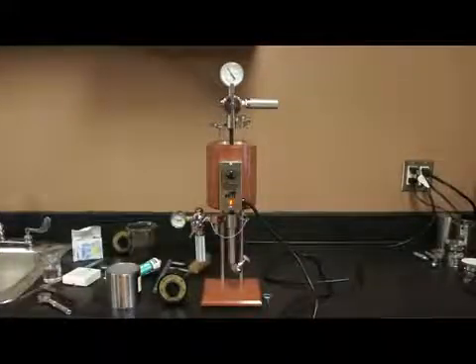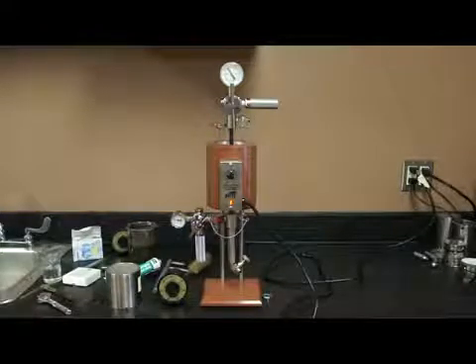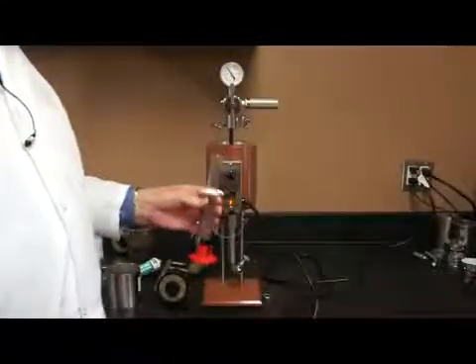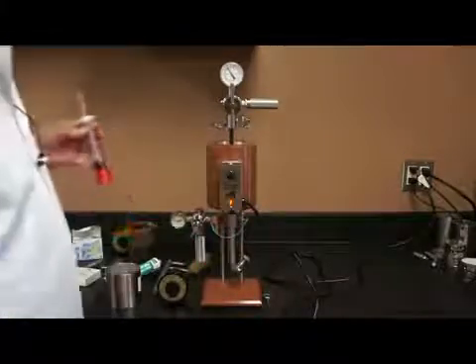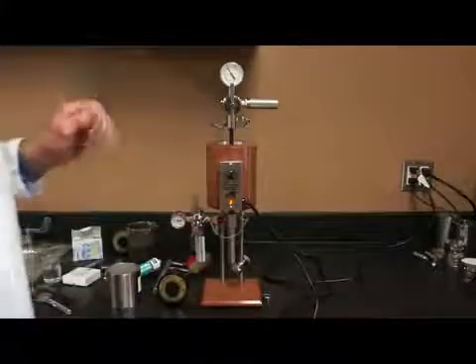So I'm going to collect one last little bit of filtrate. Basically what I did during the test, and I didn't have this recorded, but at the seven and a half minute mark I collected seven milliliters of filtrate. I'm going to collect the last little bit and see what comes out here. Not very much. So I have right at a total of 11 milliliters of filtrate. So my HTHP value would be 11 milliliters times two, it'd be 22. So the spurt loss we'll calculate in a minute.